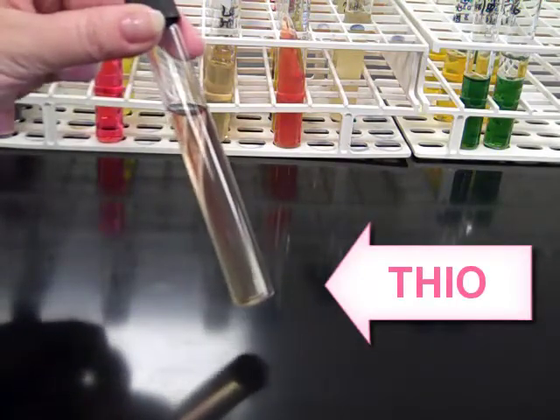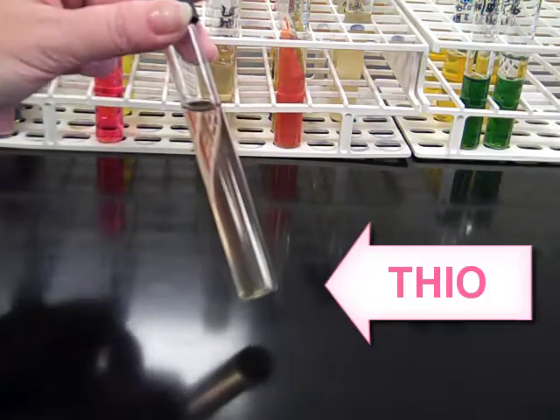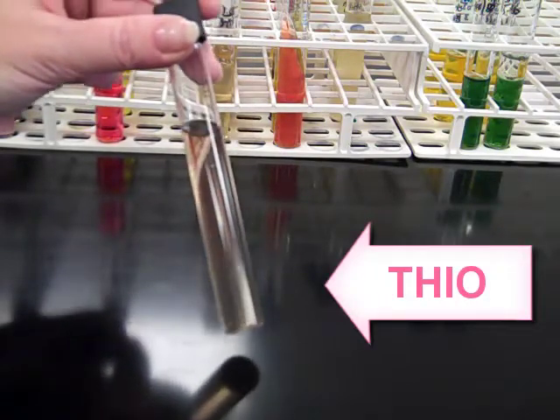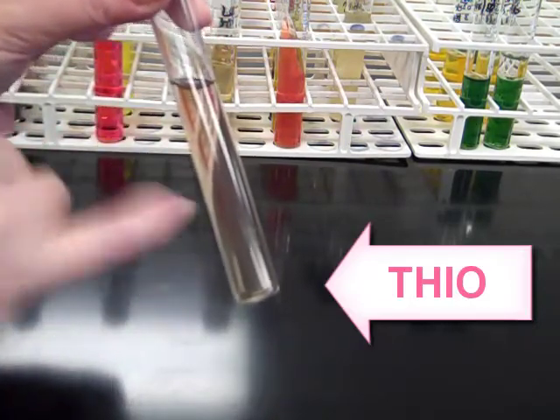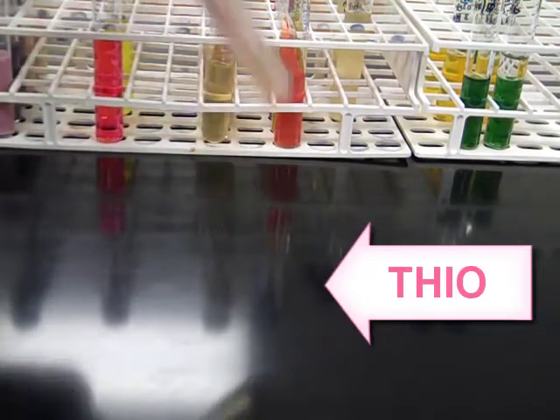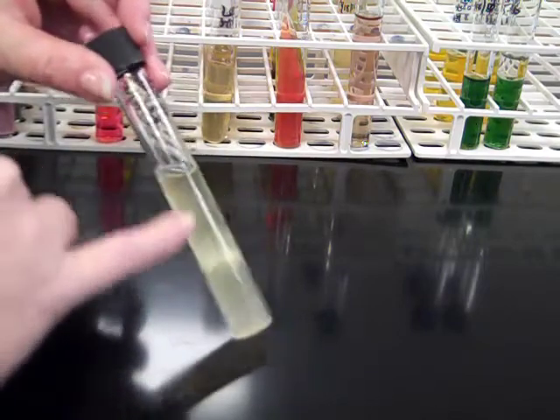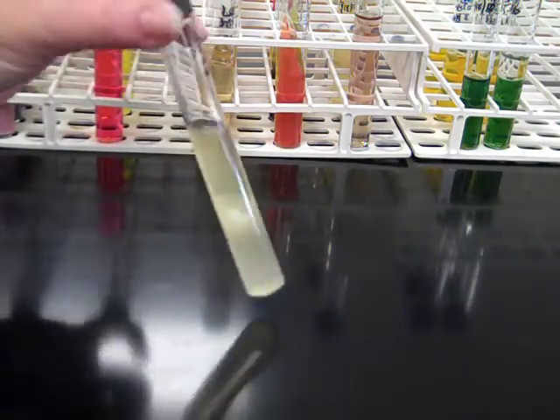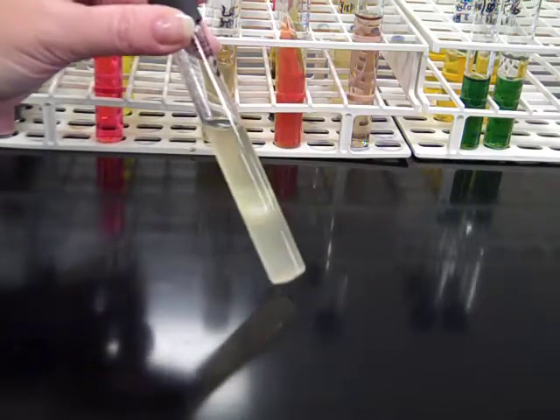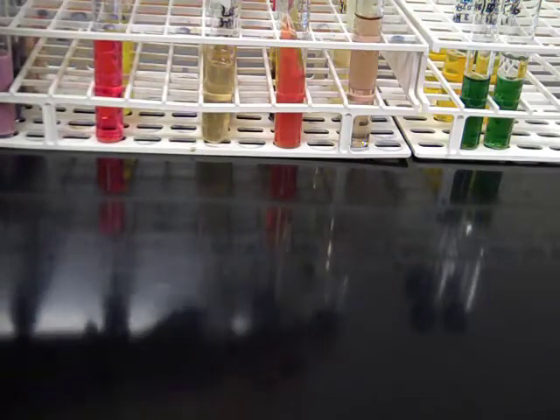All right, the next tube we're going to be looking at is thioglycolate. Thioglycolate is testing for anaerobic versus aerobic growth. So a tall column, sort of a champagne pink color. We're looking for growth primarily at the surface, primarily at the bottom, or anywhere in between to differentiate obligate from facultative anaerobic. An organism that grows throughout the entire tube, so we see growth, turbidity at the bottom, at the top, in the middle, in any combination, that organism is a facultative anaerobe. It can grow with or without the presence of oxygen.